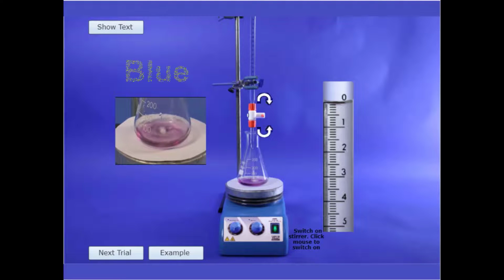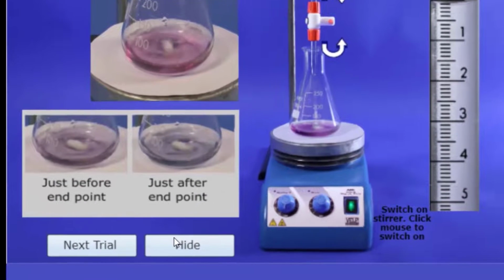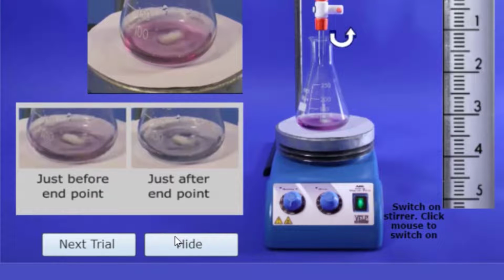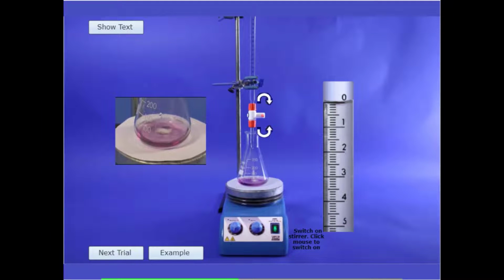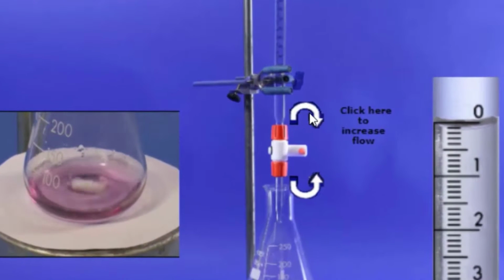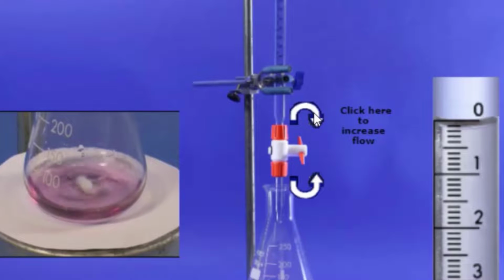The solution will turn blue when the EDTA has reacted with all calcium and magnesium ions present. Click on the example button to see the color you will observe just before and just after the endpoint of the titration. Once you have recorded the initial burette reading, you can now open the burette tap by clicking on the rotation button. You can increase the rate of the flow with further clicks.